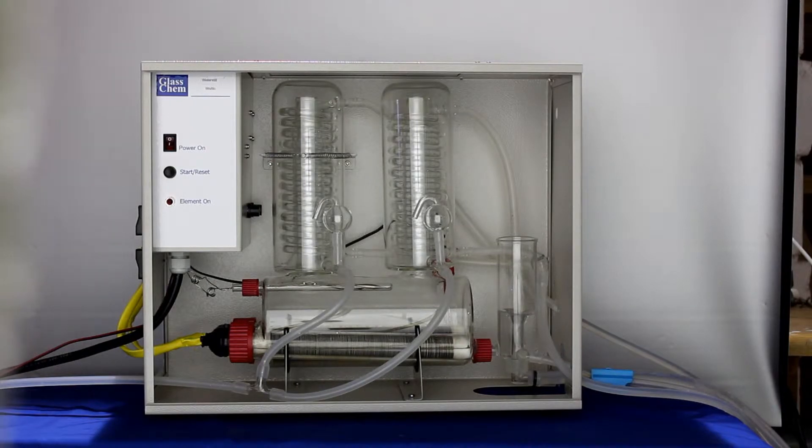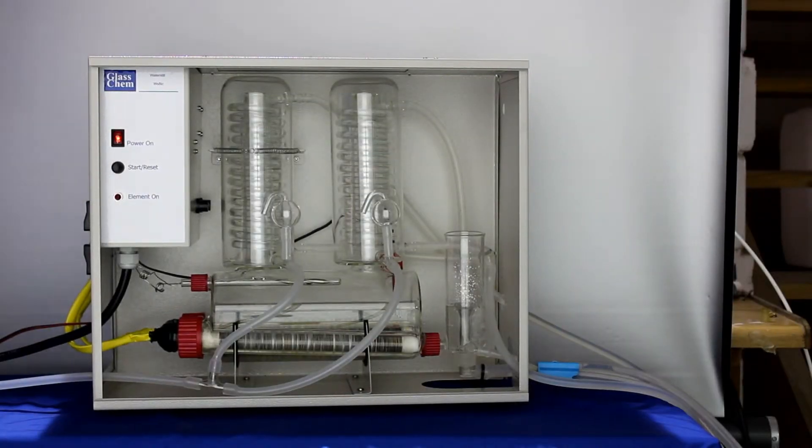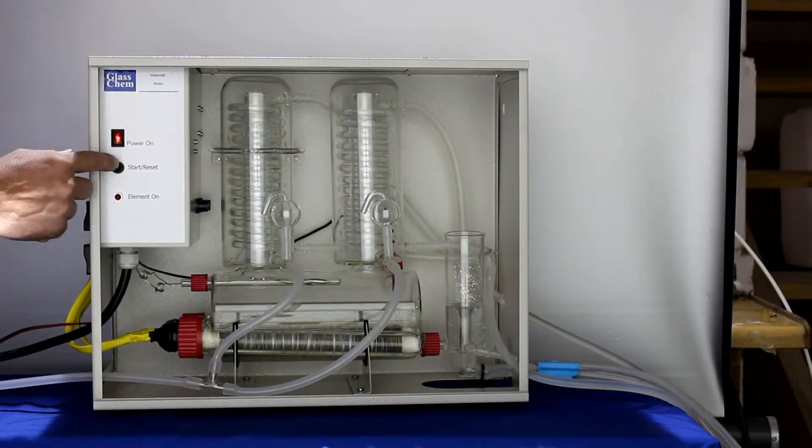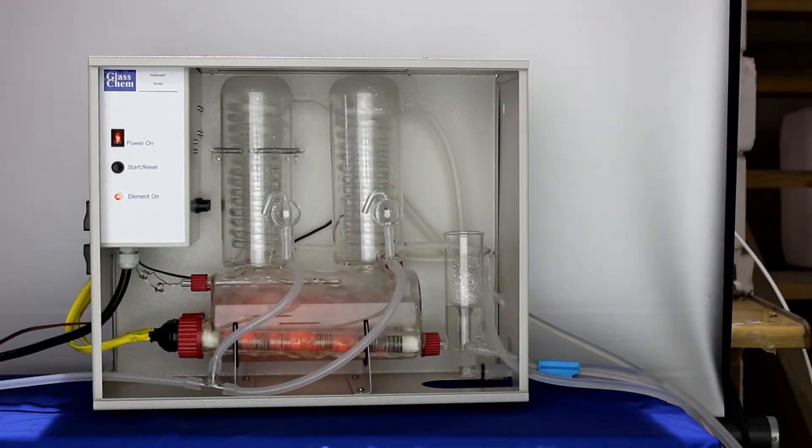Start by opening the water supply to fill the boiler. The water level will rise inside the boiler. Switch on the still and press the start button. The water will start to boil inside the boiler.